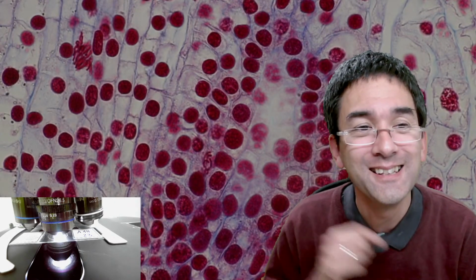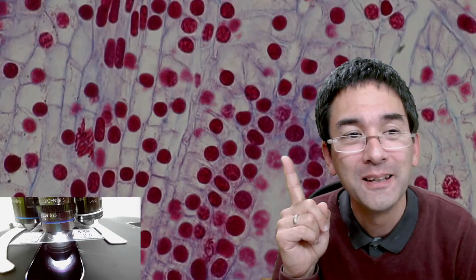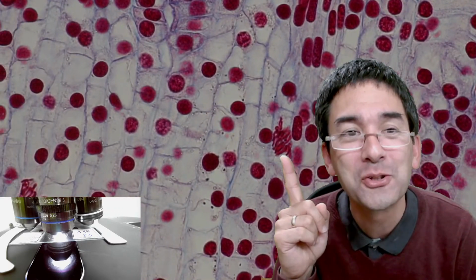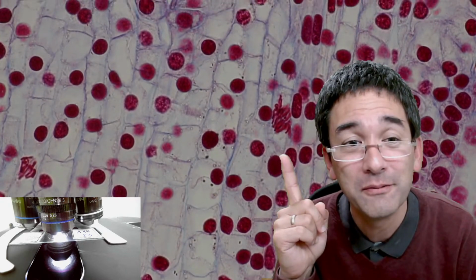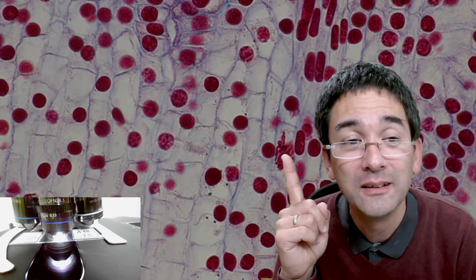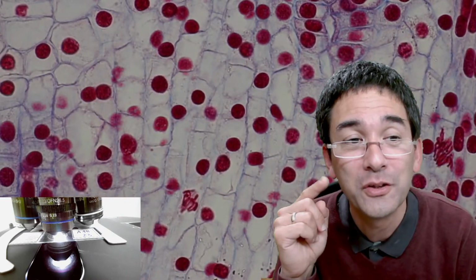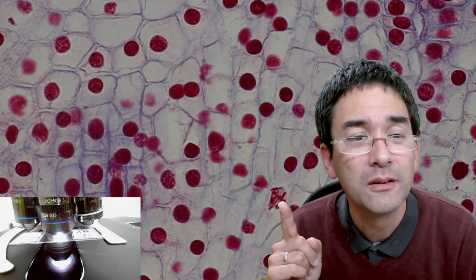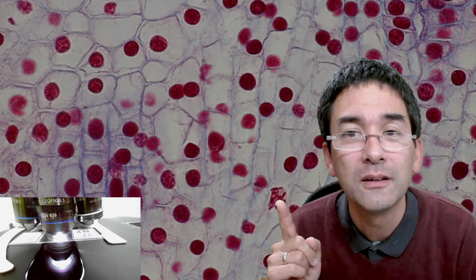Look at this. Look, isn't this nice? Look, I'm going to point to this. This is a huge one. Look at all of those chromosomes here. Must be also metaphase. Yeah, all of those chromosomes. And over here as well, metaphase again. Why so many metaphase? Yeah, metaphase here. Again, you see that the chromosome arms are pointing outwards.